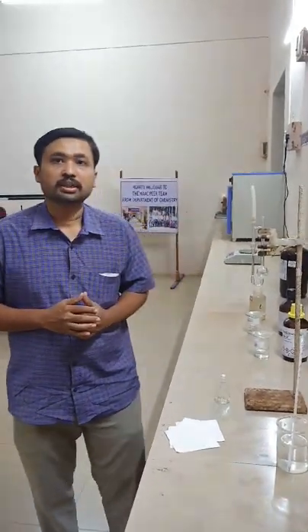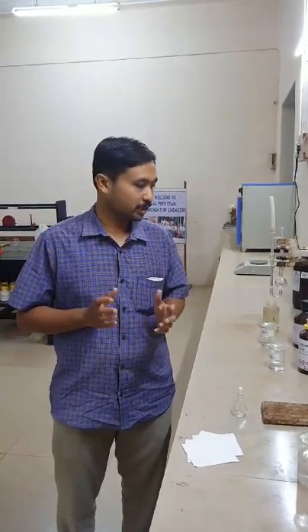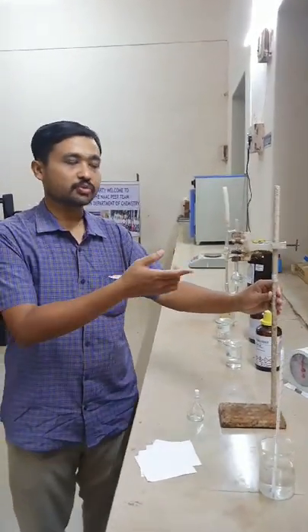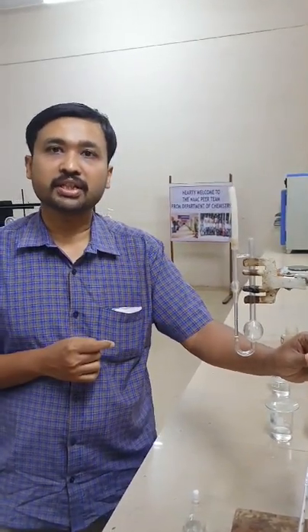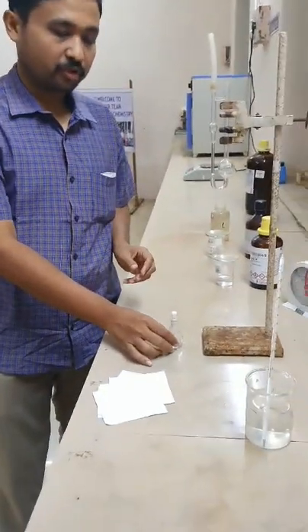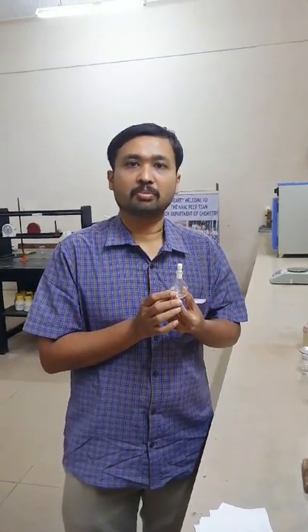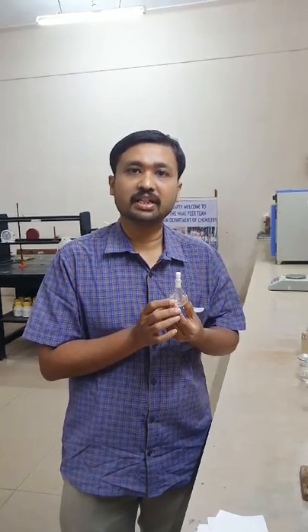First, let us know the requirements of the experiment — what chemicals and apparatus are required. First and foremost, we require an apparatus called Ostwald's viscometer, which is used for measuring the time of flow of the given liquid. We also require a density bottle, also called a specific gravity bottle or pycnometer, which is used for determining the density of the given liquid.